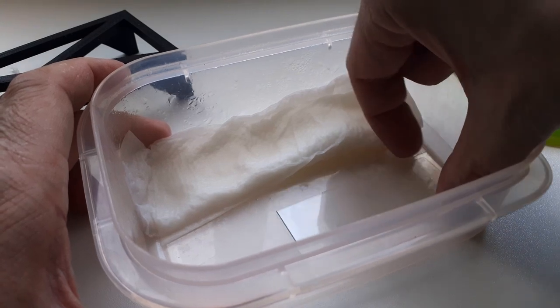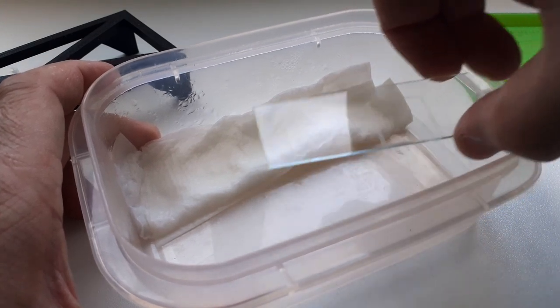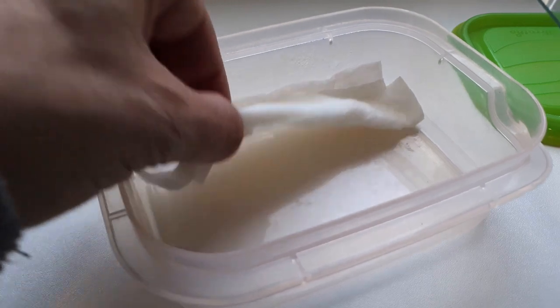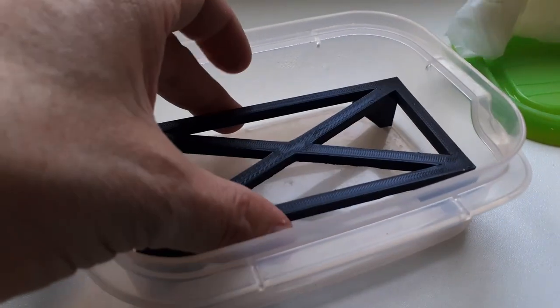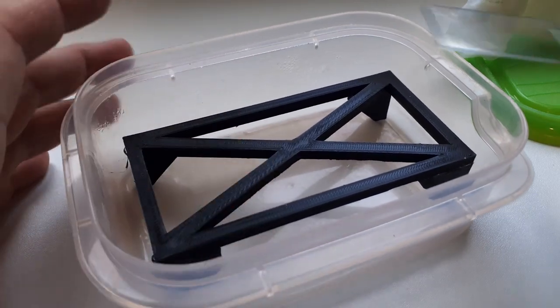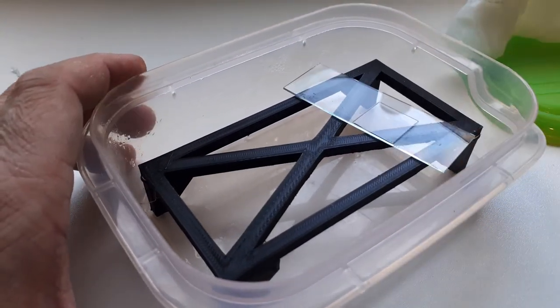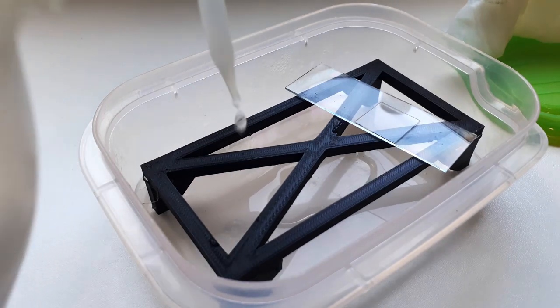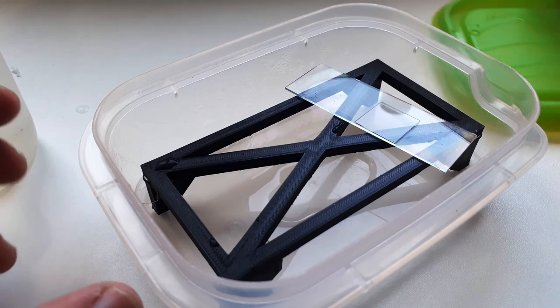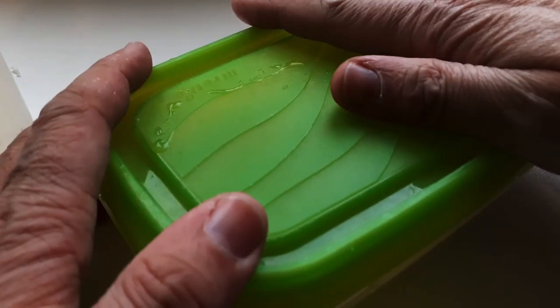Here, this is the old system that I used. It has a little bit of wet tissue paper still in it. Just simply throw it out, and the rack goes in here, slide goes on top, and then of course you have to add a little bit of water, and then you have your humidity chamber finished. Yeah, simply some tap water, and that's all there is to it. Lid is very important, otherwise the evaporation goes on, of course. Yeah, but that's it.